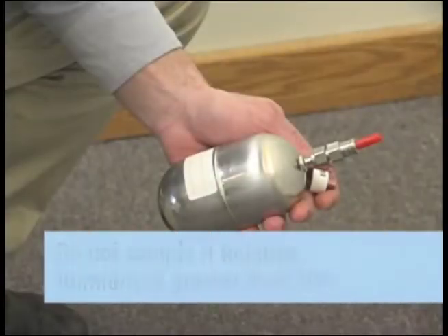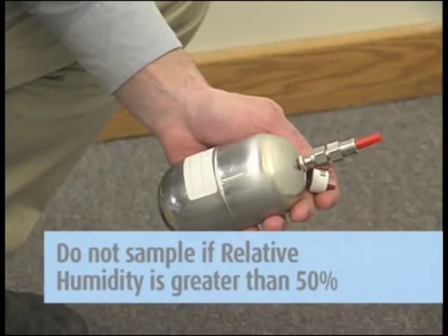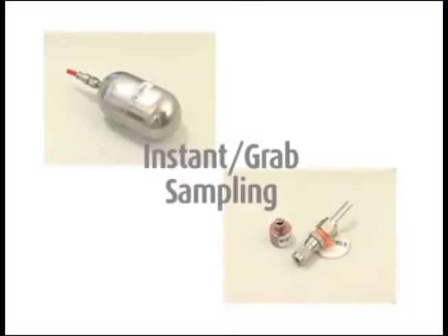Here's a tip for all sampling events: Do not sample if relative humidity is greater than 50%.